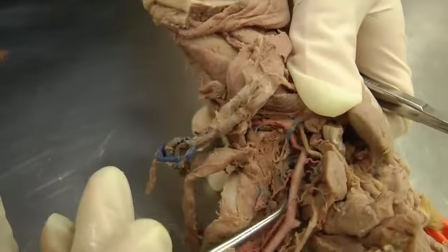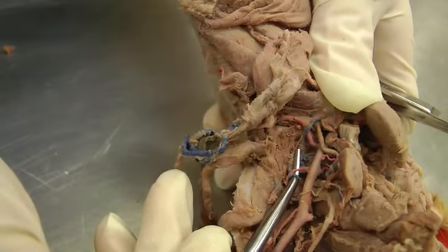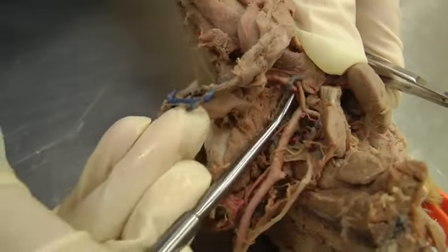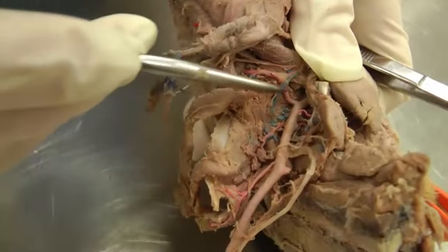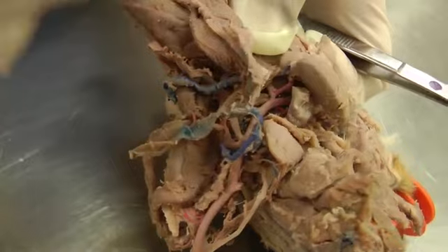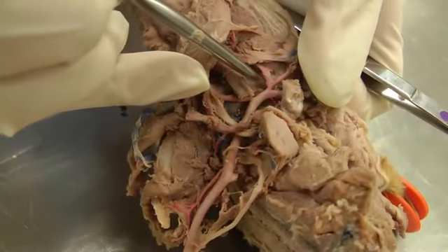And it looks like we might even have that little bit of the cranial laryngeal artery there. And then we have the lingual is the next one. So lingual artery right here coming up, going to the tongue. So lingual. Then we continue to follow this. I'll just kind of move things around here. And so the next piece we're looking for then is the facial.